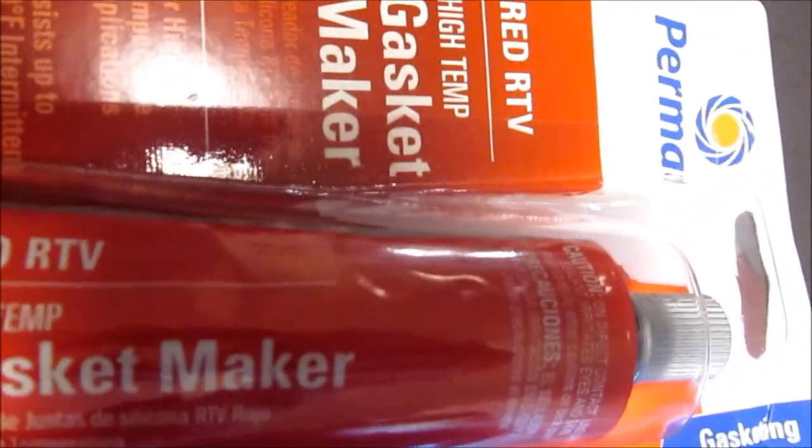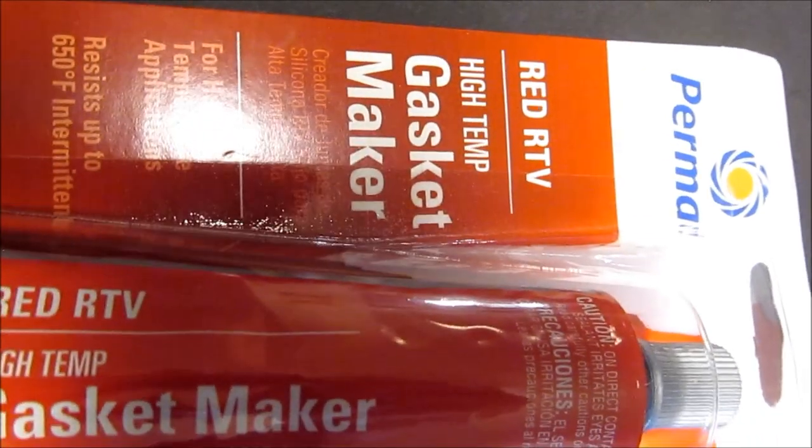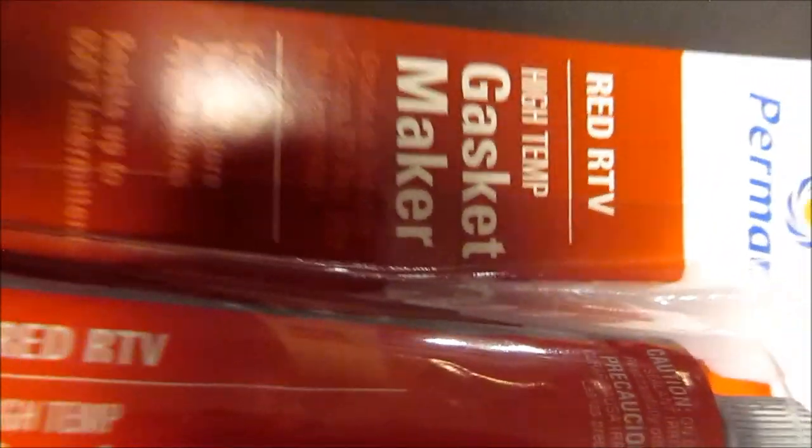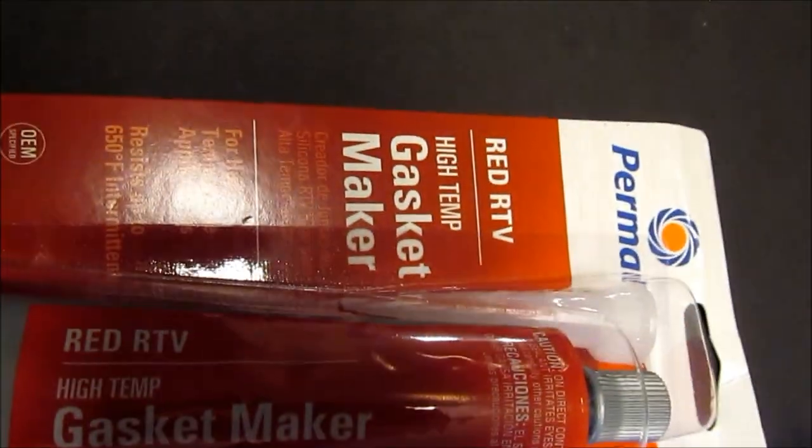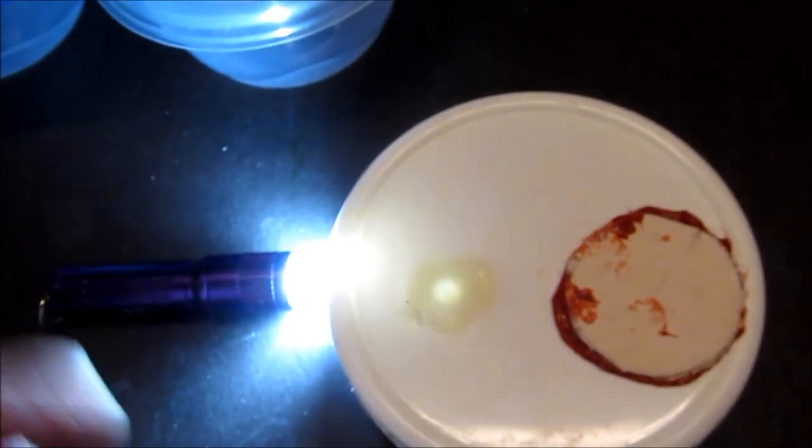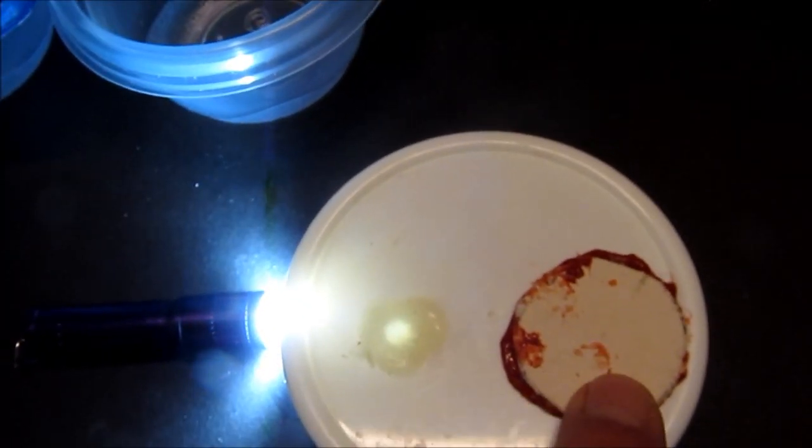This fine piece of craftsmanship here is a piece of synthetic filter disc. You can get them on Amazon and it's secured with RTV glue. Got that at Walmart. Almost any automotive supply place carries it - RTV, got to be the high temperature gasket maker so it'll survive the pressure cooking. Then you use just a little bead around the edges of this because you don't want to block that hole. You got to make sure you've got good air exchange and gas exchange through that hole.